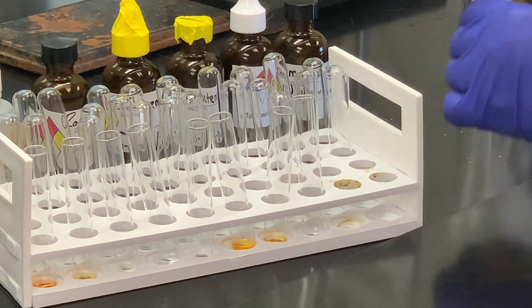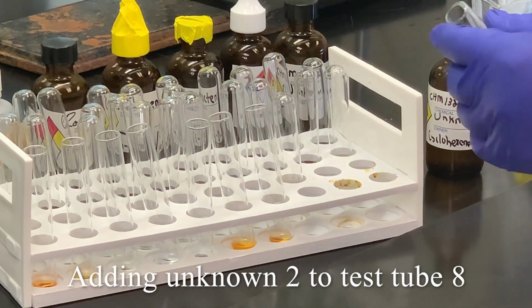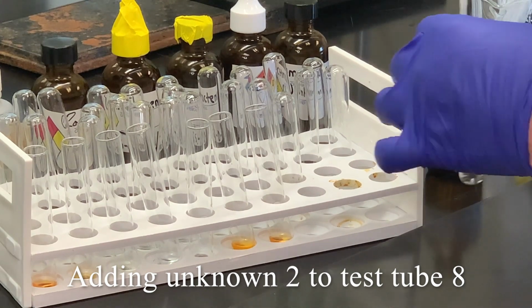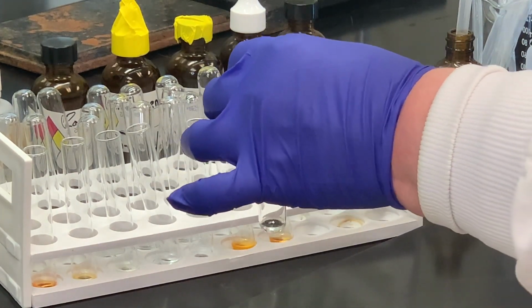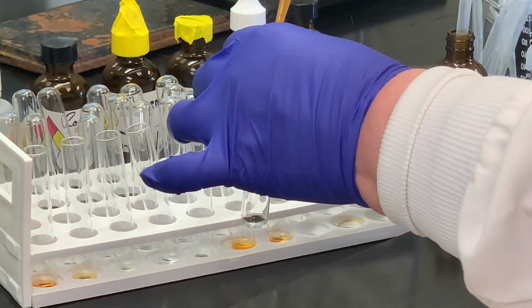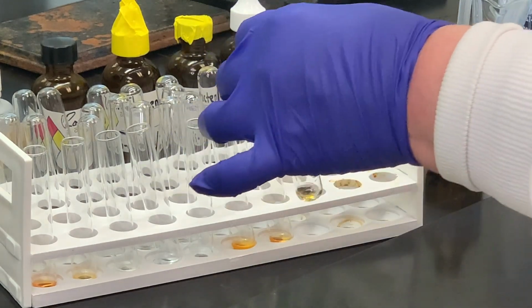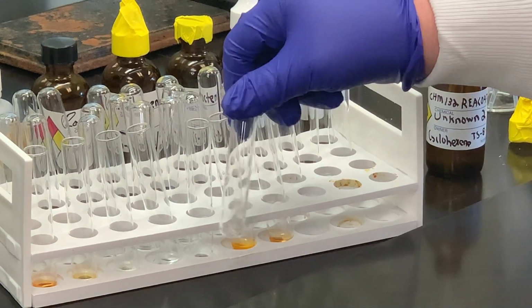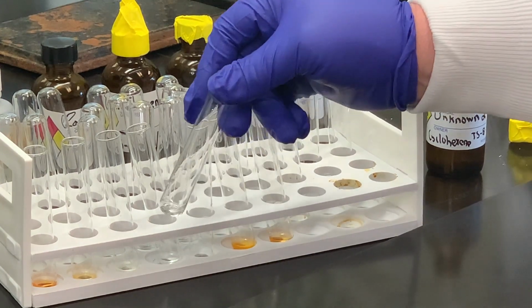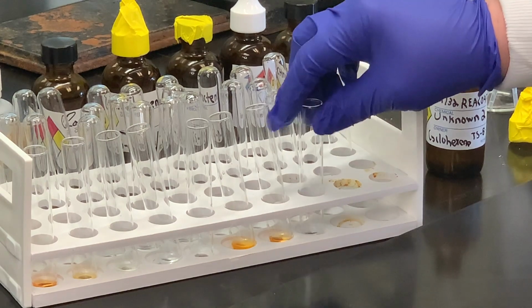And then for unknown 2, add a few drops of the unknown, and then a couple drops of the bromine. And you can tell that the orange color disappeared, so that would be indicative of a positive result, presence of a carbon-carbon double bond.